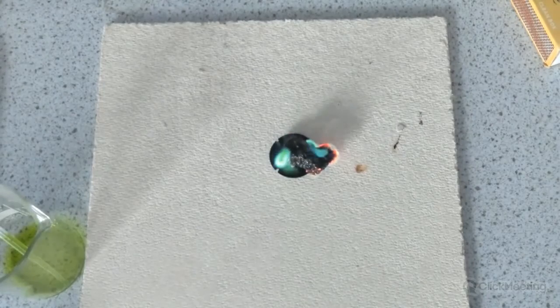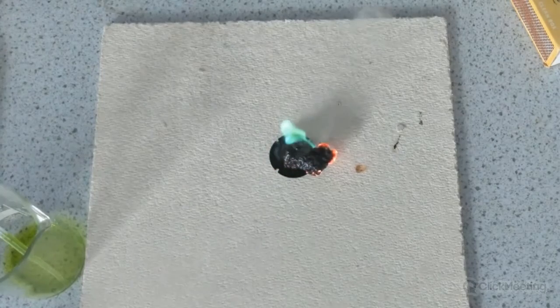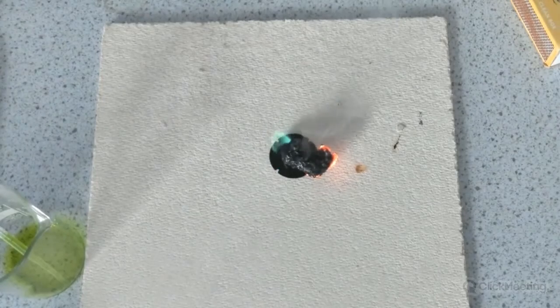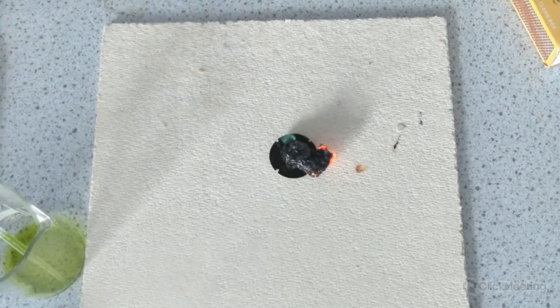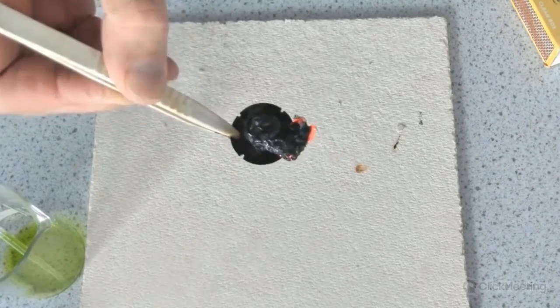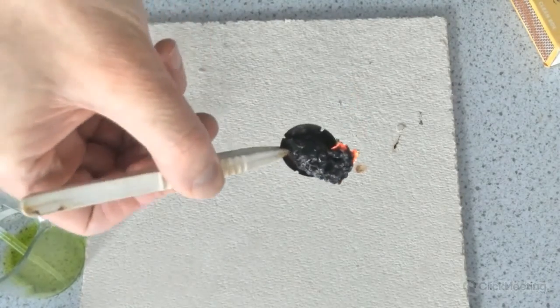One thing to note as well is that the tops of the bottle tops can get quite hot. So make sure you handle them with forceps, as they keep their heat more than you think. This is a nice way of doing a flame test in a microscale method. Make sure your visualizer or video camera is far away, because it can get quite hot as well, and you're at risk of damaging the actual camera. You can do this with copper chloride. I've only tried this with copper chloride and lithium chloride, but you can see we've got our little carbon snake in the bottle top there.